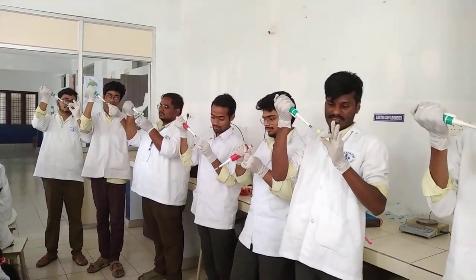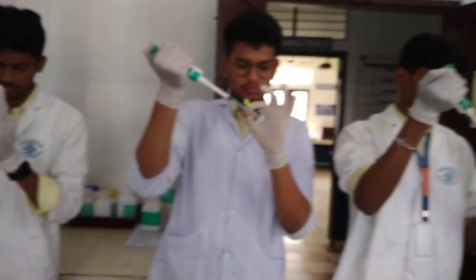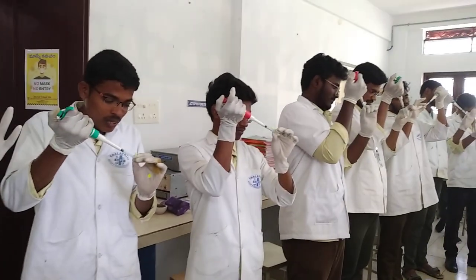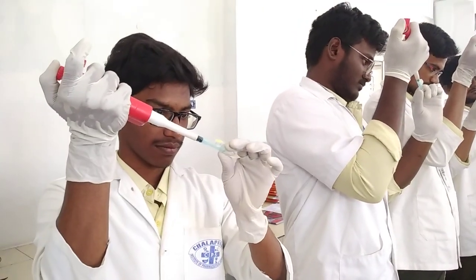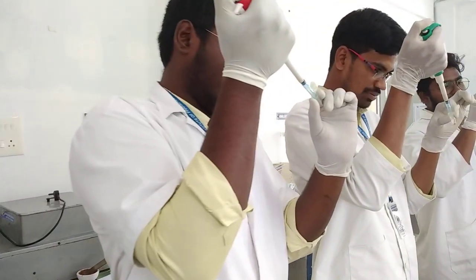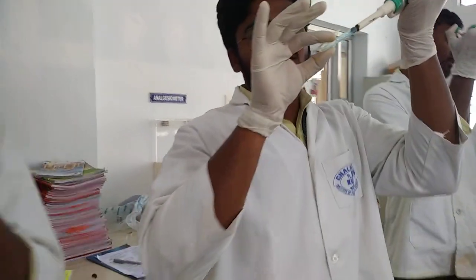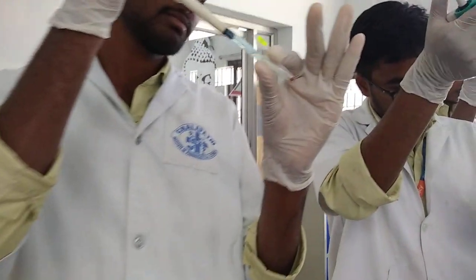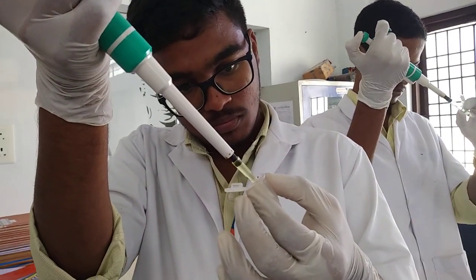Take liquid. Enter into the liquid. Take liquid in and out, in and out, close to the cell. Keep the tip close to the cell. Take in and out, in and out. Repeat as many times as you can do.